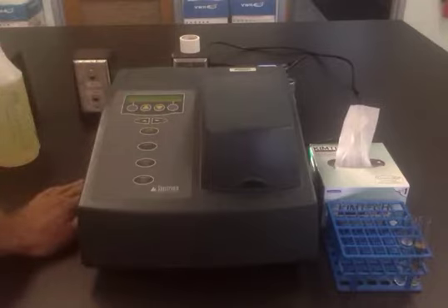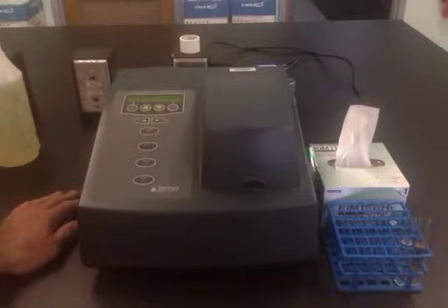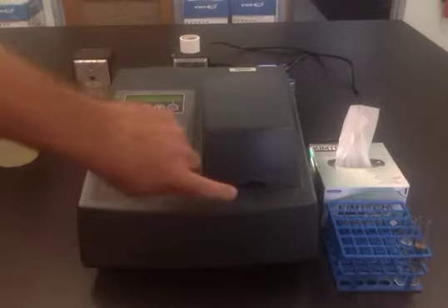It should give you a reading at a particular wavelength in nanometers and an absorbance value. If it does not, you can press this button here, the A/T/C button, which will change the type of reading that you are receiving, to get it to be the A mode for absorbance. There is a sample compartment.